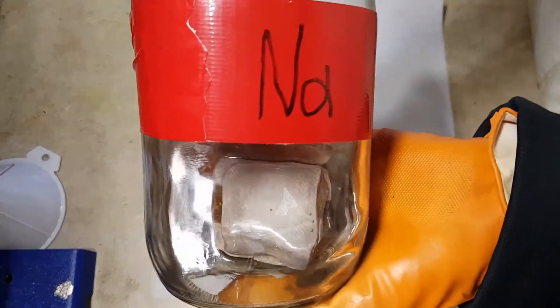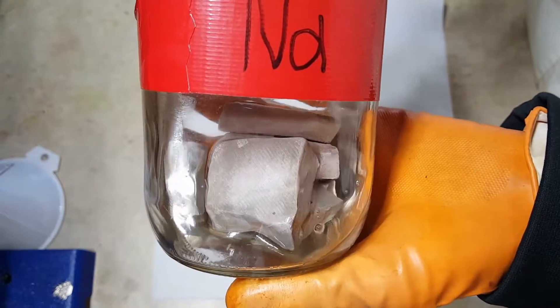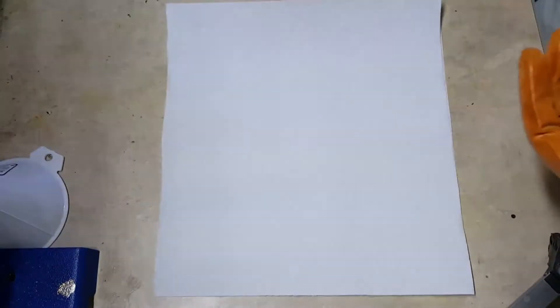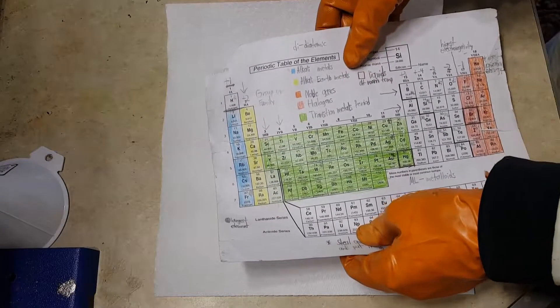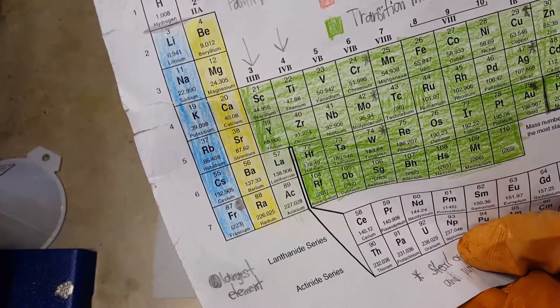So this is pure metallic sodium. Yes, sodium is actually a metal all by itself when it's bound with nothing else. So it's a very soft, reactive metal. Let me show you where it is on the periodic table. Sodium is right here with the alkali metals.